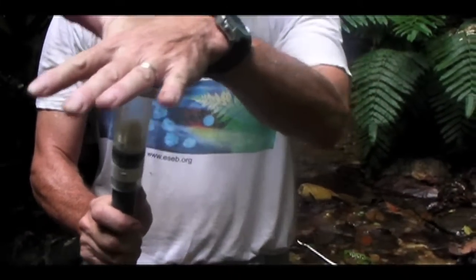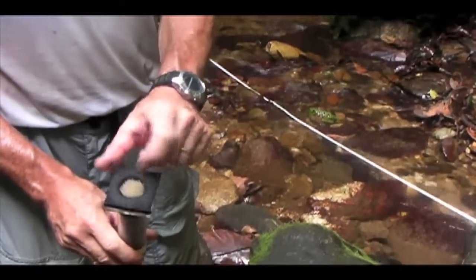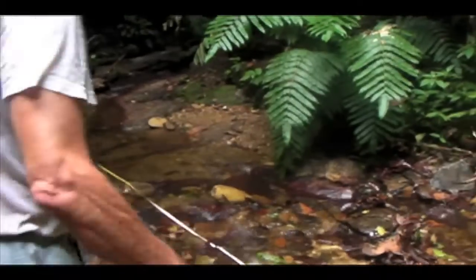And then I put my hand over it and I save that sample. And it's that we use to get a sample of what it was that was actually on the surface of the rock that I'll be sampling. And this also represents the standard sampling area, so that the samples are fairly uniform from one to the next. Okay, now I'll demonstrate.